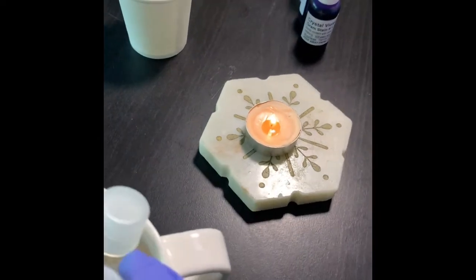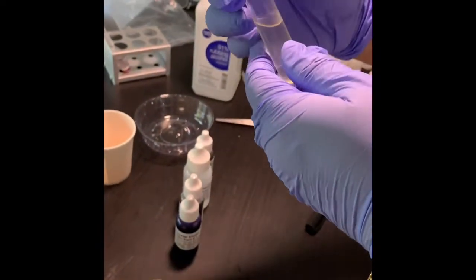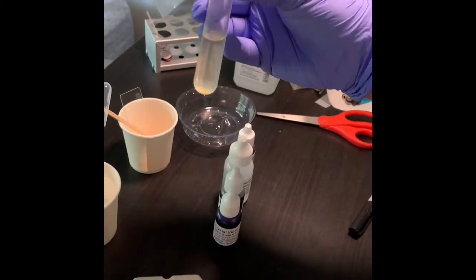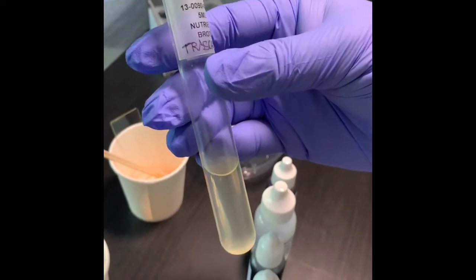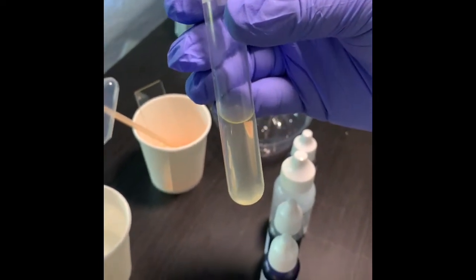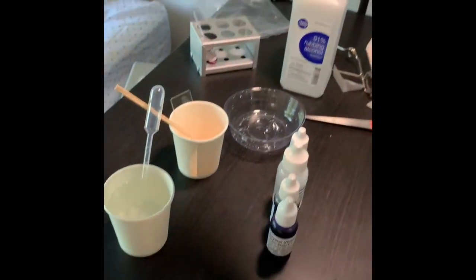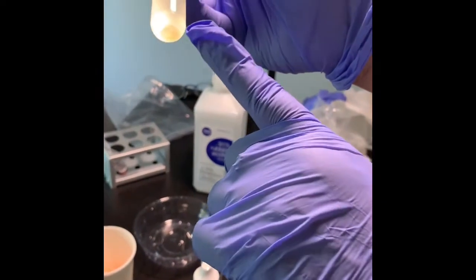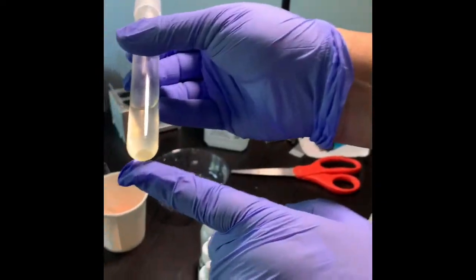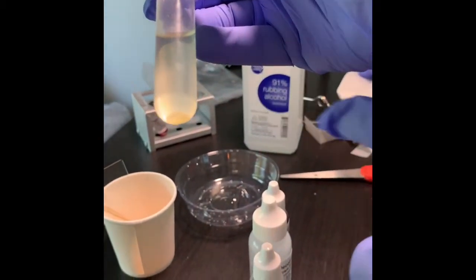Now from the last lab, I hope you have made the observations of how your broth culture looks. So you see how turbid it is, which I actually took from the trash can. You can see yours, which you have taken from your skin. At the bottom also there is some flocculent growth. You can see a thickness, like a kind of pellet-like thing. So that growth is over here.